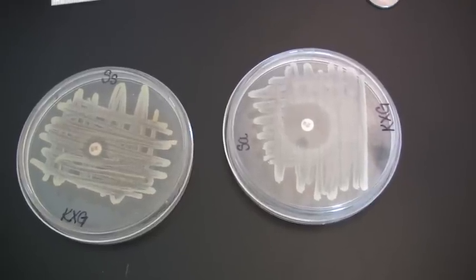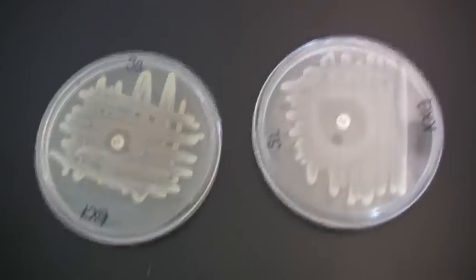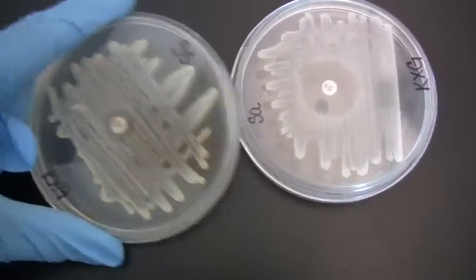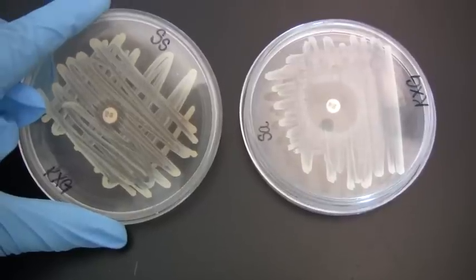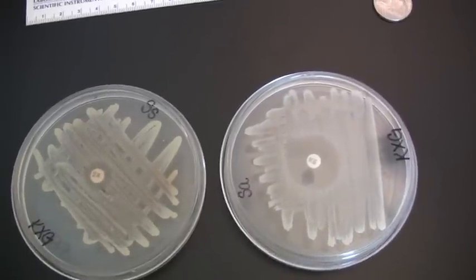This video gives an overview of the Novobiocin antibiotic sensitivity test. In many of the antibiotic sensitivity tests, you're using a particular disc that's impregnated with a specific antibiotic. And it's always important that you look at what the relevant zone of clearing should be in order for the organism to be considered sensitive versus resistant.